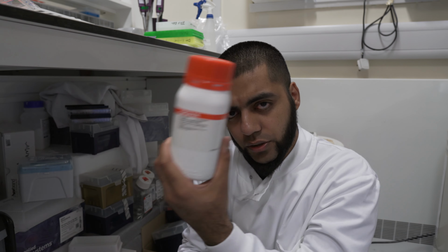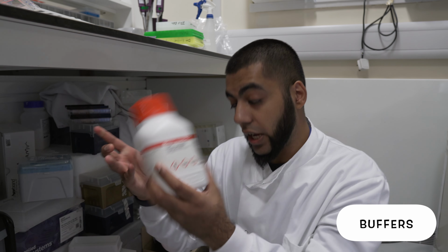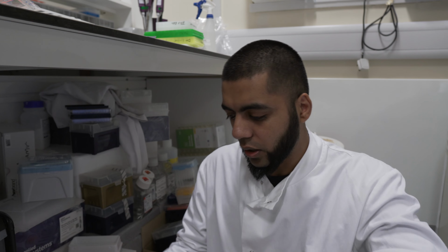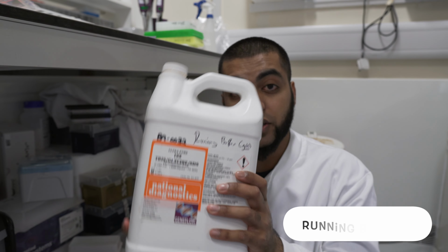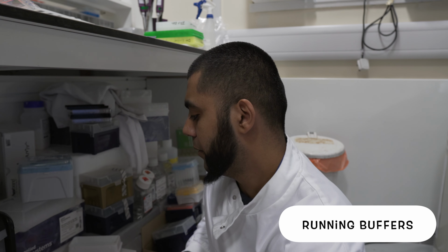So that assay I mentioned to you about in terms of analyzing mast cell activation via an enzyme, we use stuff like sodium bicarbonate, sodium carbonate, trisodium citrate, citric monohydrate, stuff like this, to make up those buffers that we need for that assay. Now, along with that, we have the usual ELISA buffer and wash buffers and stuff like that, reagent diluents. Got running buffer and transfer buffer for Western blot that I use.